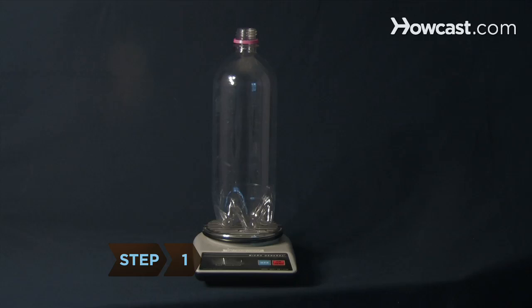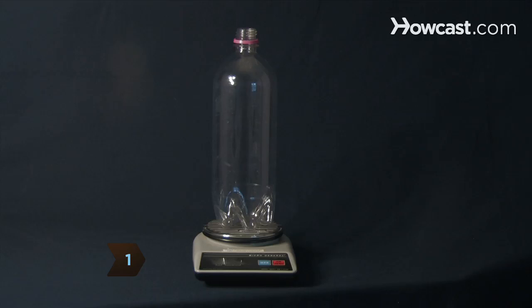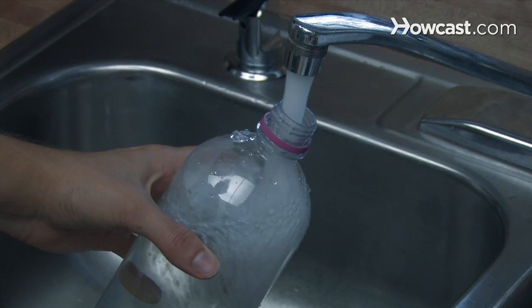Step 1. Weigh an empty 1-liter bottle on an electronic balance, and then fill it with room-temperature tap water.